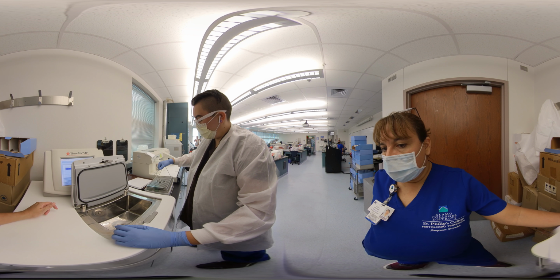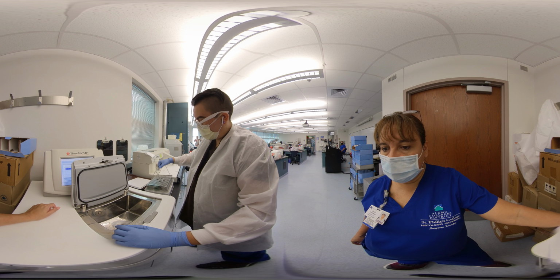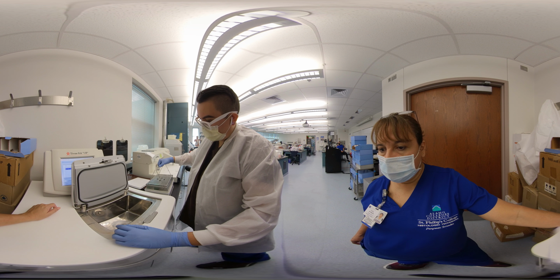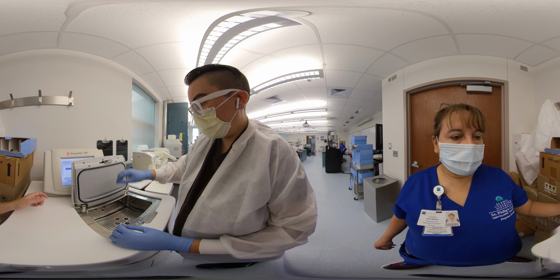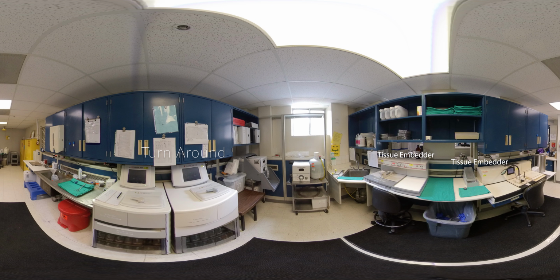It is also good to know what it looks like when the tissue processor is loaded. Notice in this video a cage full of tissue cassettes are loaded into the processor. Once tissue processing is completed, the tissue is removed from the tissue processor and transferred to the embedder. Here are the embedders you saw in your first lesson. Now let's take a look at what embedding looks like as it occurs.